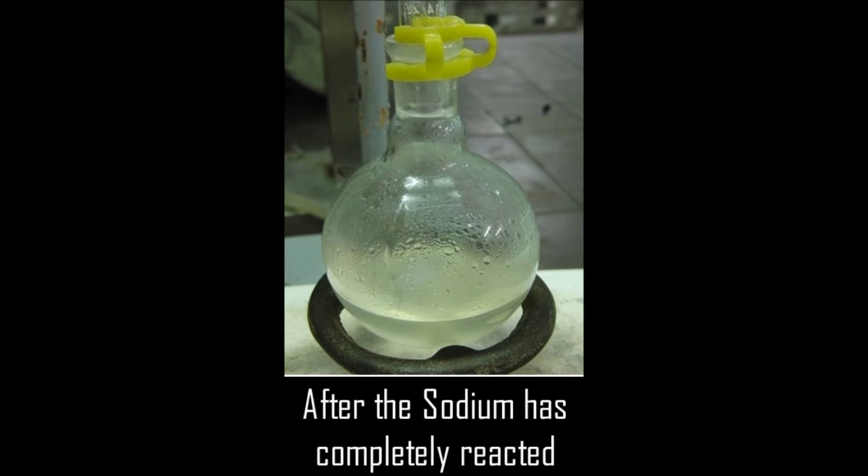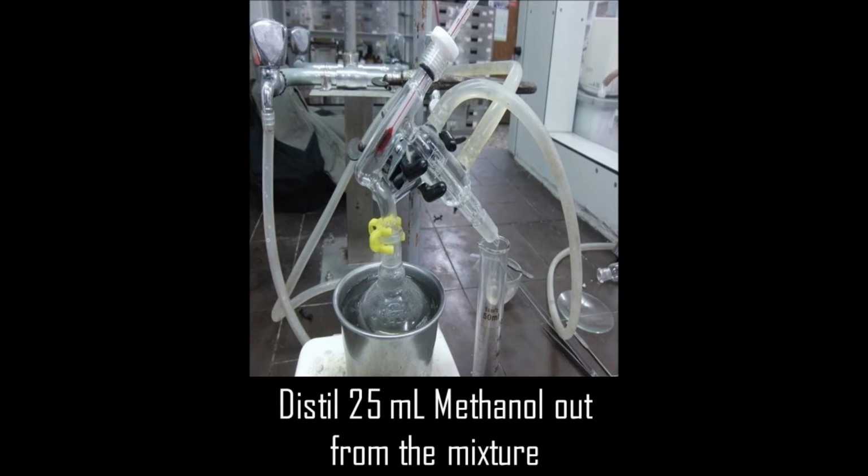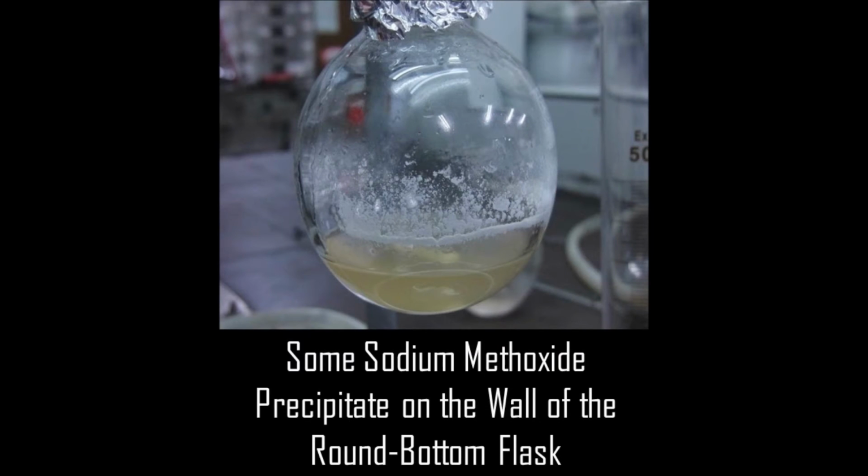After the sodium has completely reacted, fit the flask for a simple distillation. Put a stir bar into the reaction flask and distill 25 ml of methanol into a graduated cylinder. If it is necessary to stop the experiment at this point, store the sodium methoxide in the round bottom flask with a heavily greased glass stopper.